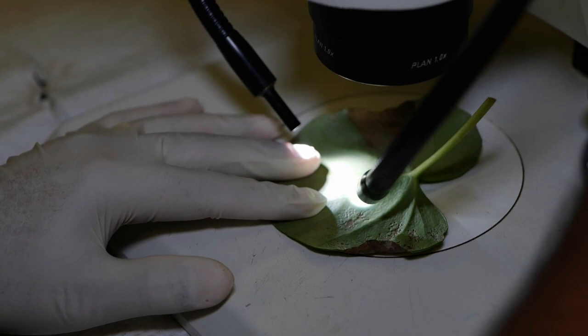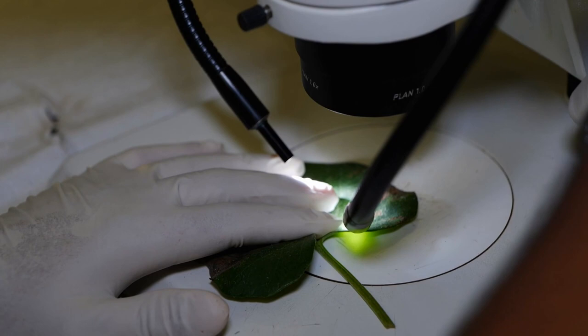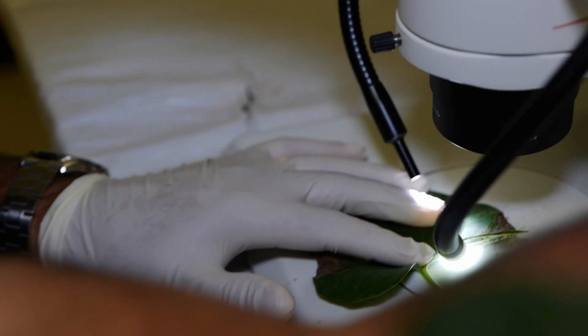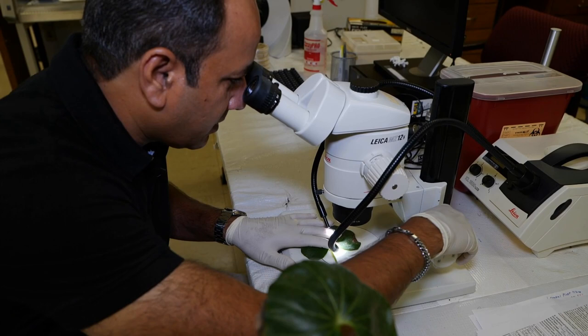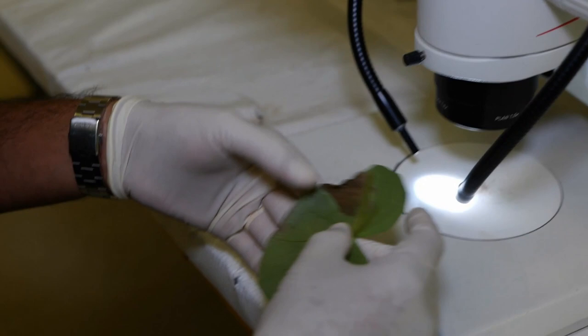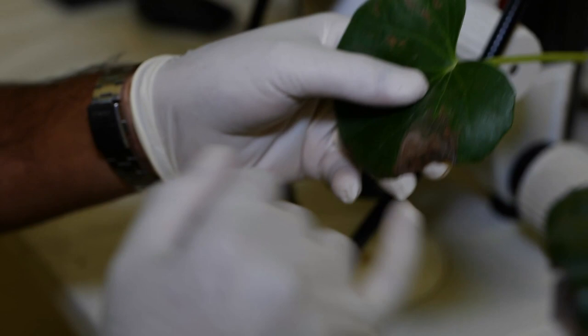I'm also trying to see if there is any - because sometimes what you see is you can look at the spots, leaf spots, and you can have a little bit of idea if it is produced by a fungal pathogen or bacterial pathogen. Also, sometimes viruses may produce similar kind of symptoms. I'm just looking for any signs or any symptom similarity here.